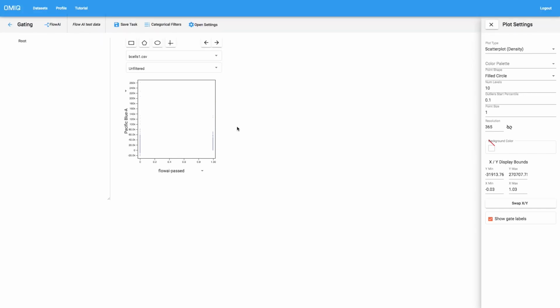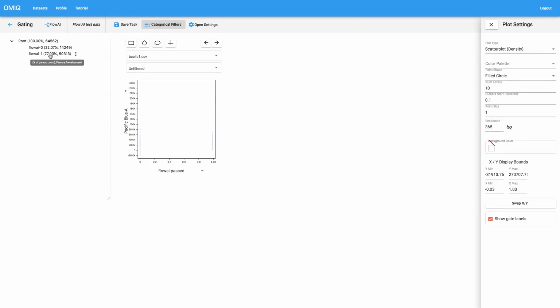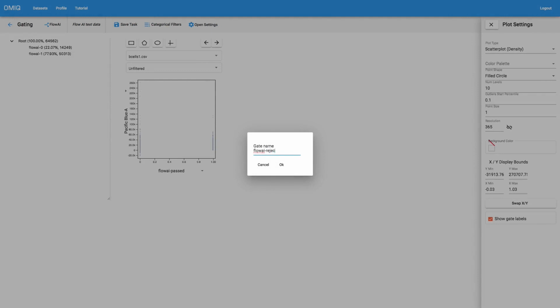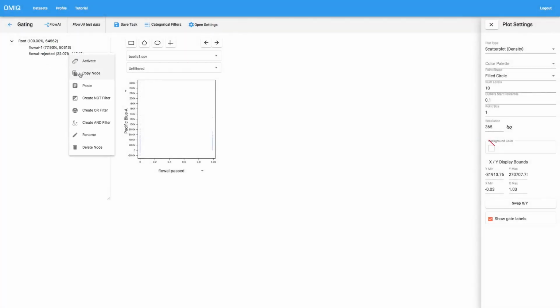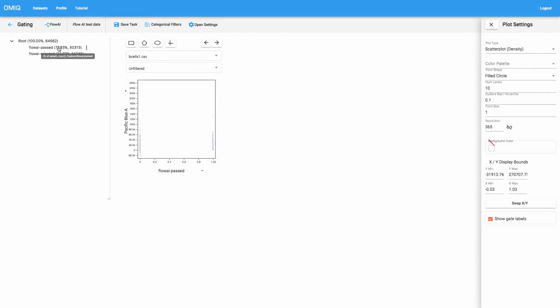And so as you're probably used to from other forms of analysis in OMIQ, we can grab these encoded values by way of using categorical filters. And so one easy way to do this would be to just choose the flowai-passed channel here, and then just give this a prefix of flowai. And then we're going to get values 0 and 1. And then if we want, we can easily rename these to, for example, flowai rejected. And the second one could be flowai-passed. And so now we have an idea of which data points were passed and which were rejected, and we know the statistics. So we can go ahead and save that.